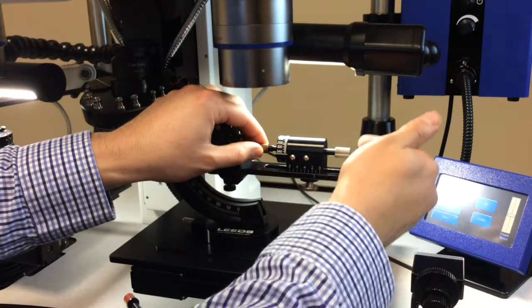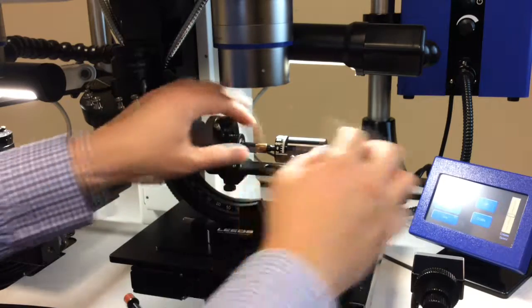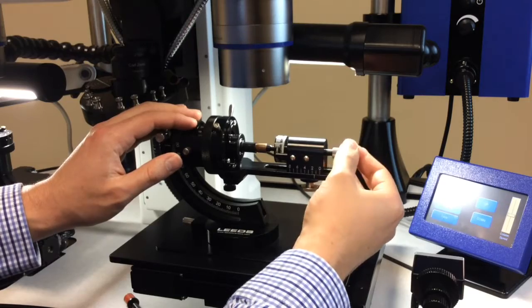And when I rotate this, the spring will engage. That's going to push the bullet into the bullet holder. Now I can fine-tune as I need and do my direct on-center observation.